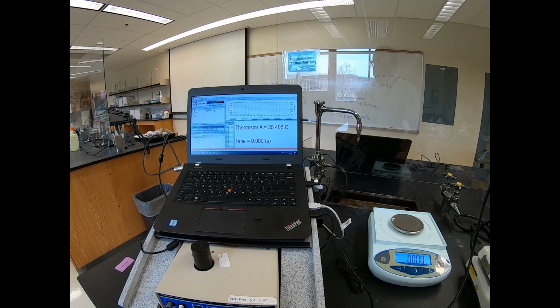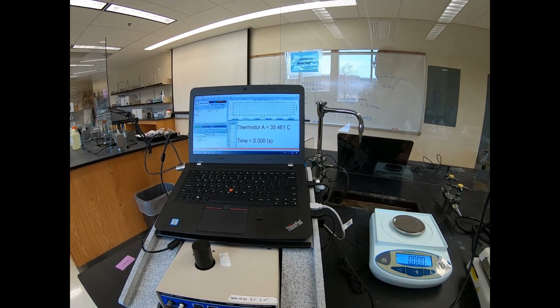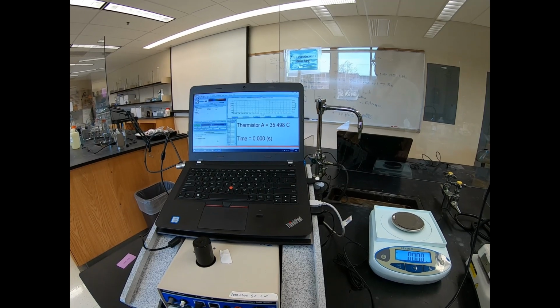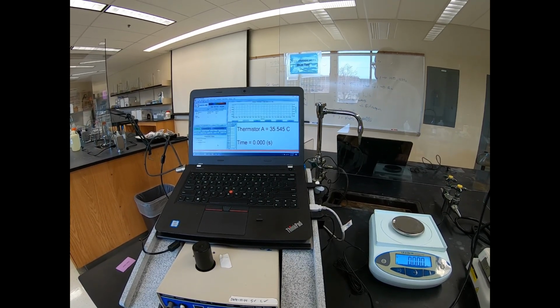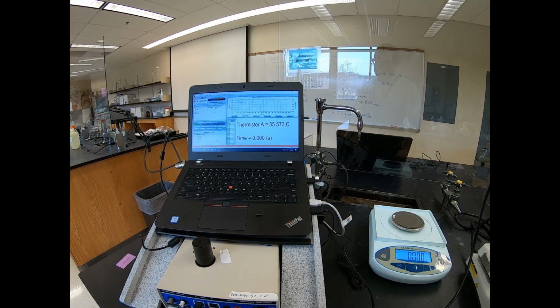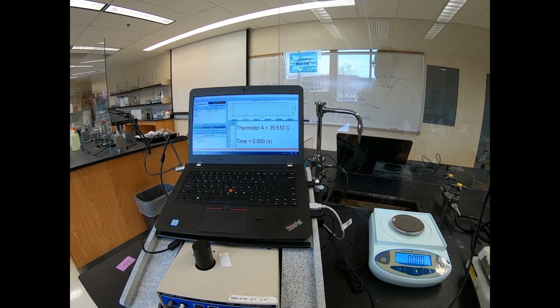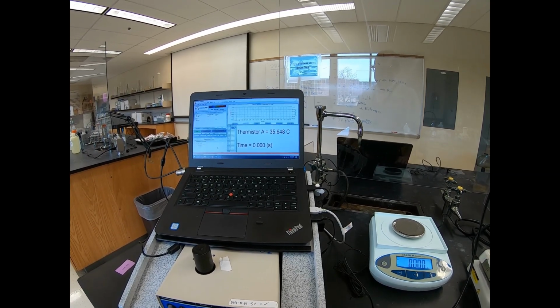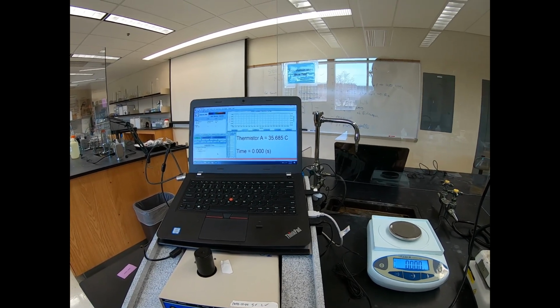It's still going up, but it's slowing way down. Still creeping up just a little bit.